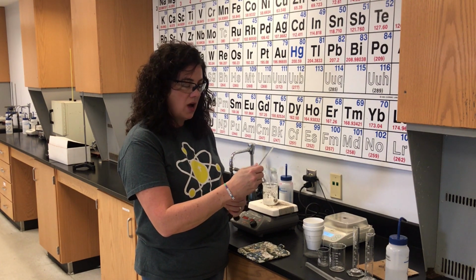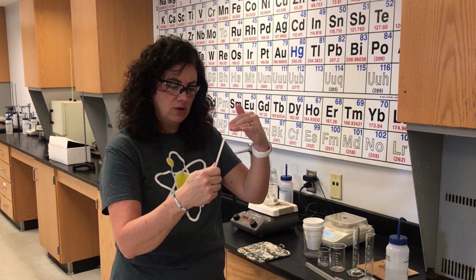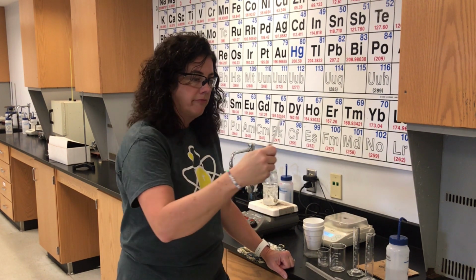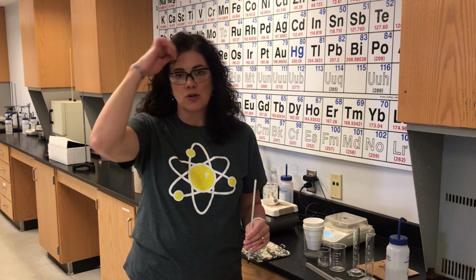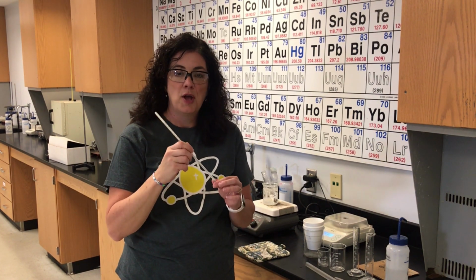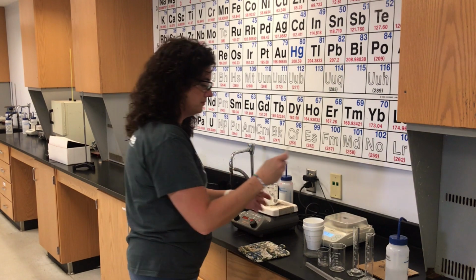My thermometer is still hot, and so I'm just going to let it cool down a little bit. And guys, these are alcohol thermometers. You don't shake those down, okay? Y'all might not have ever seen that, because probably you've grown up with thermometers that are always digital, ear thermometers or forehead or whatever. But maybe some of y'all have seen an actual real mercury thermometer, and before somebody uses it, they'll shake it down. You don't have to do that with an alcohol thermometer.